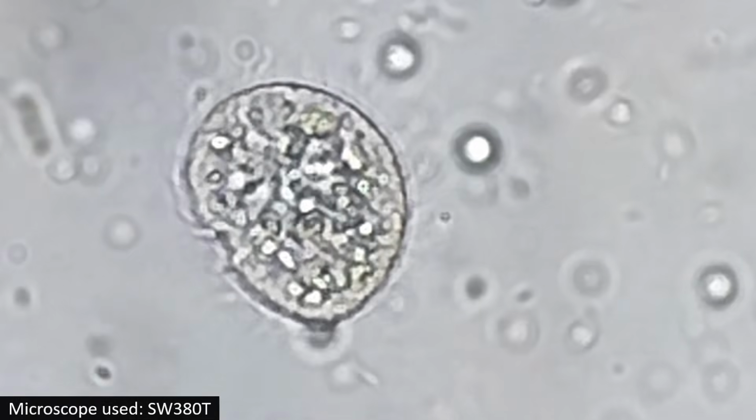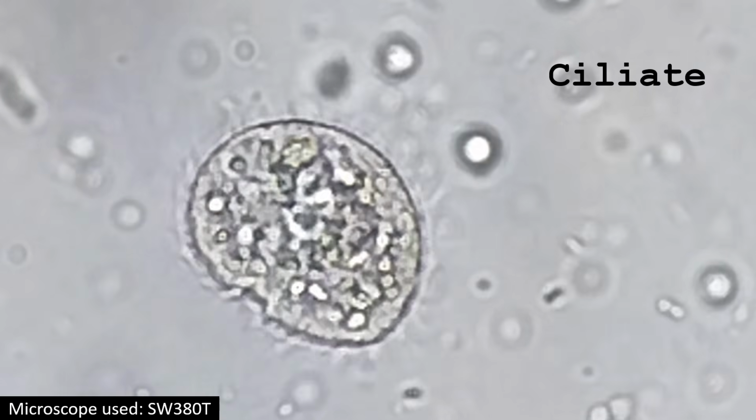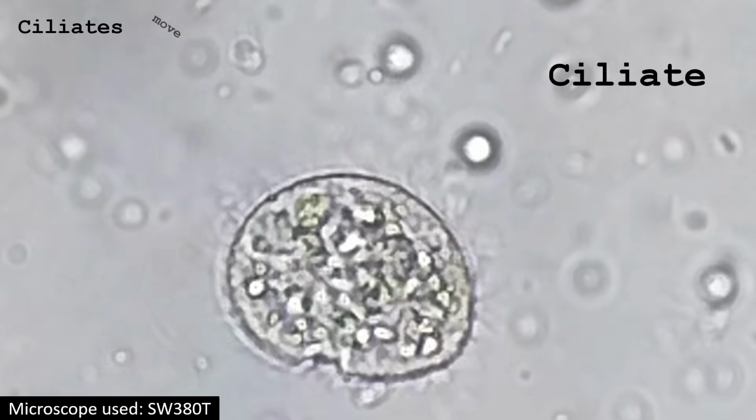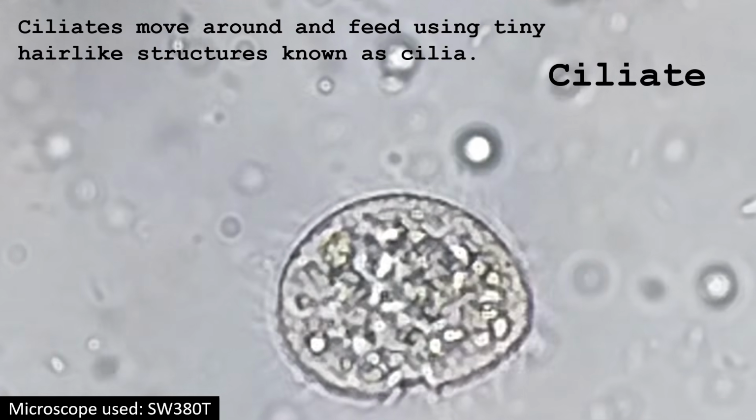This is a ciliate. Unlike rotifers and nematodes, ciliates consist of only one cell. Ciliates move around and feed using tiny hair-like structures known as cilia.